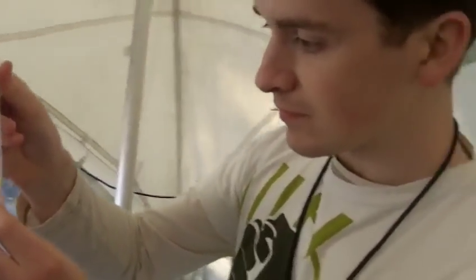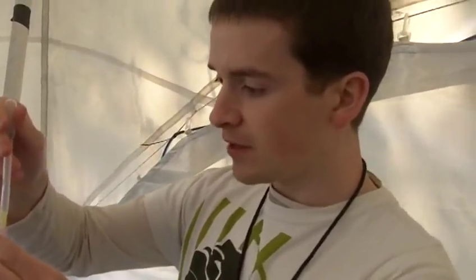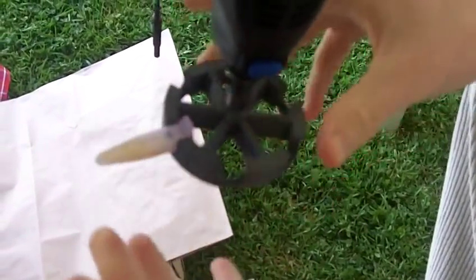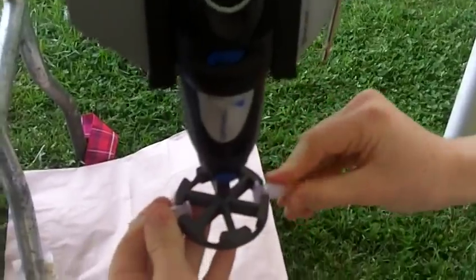We're going to talk about the centrifuge. What we've got here is a Dremel with a head on it which I designed in an open source CAD package called OpenSCAD — I could have equally designed it in Google SketchUp. What it allows you to do is clip in these industry-standard centrifuge tubes on either side. They clip in in a highly secure fashion. If you balance the centrifuge carefully so that it's got roughly equal weight on both sides — which I'm doing now — you're good to go. You should label which tube is which.